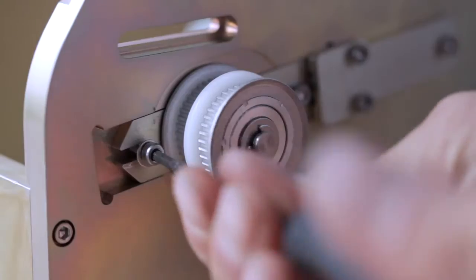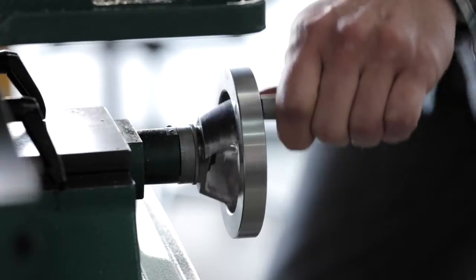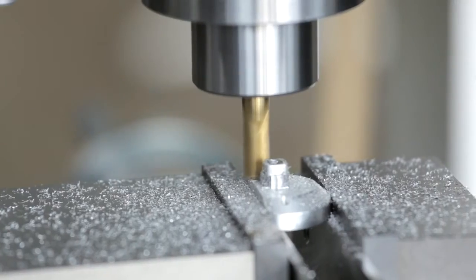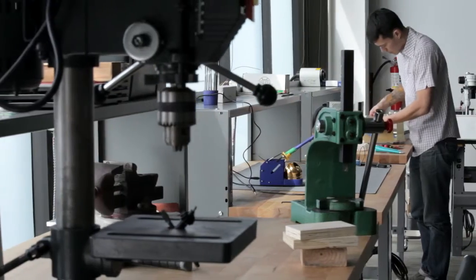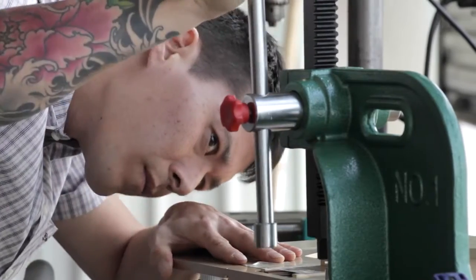We wanted to see if we could build a hybrid microscope, one that could easily convert between the two. So just for fun, we built one in our garage, and here we have this today.